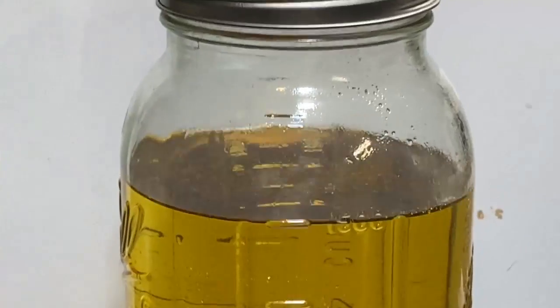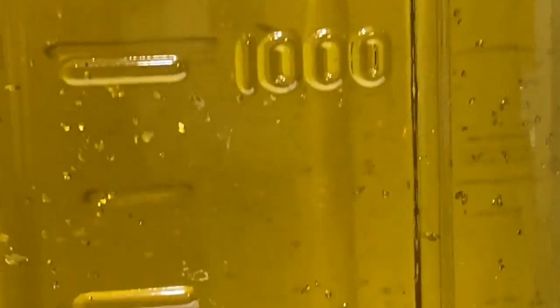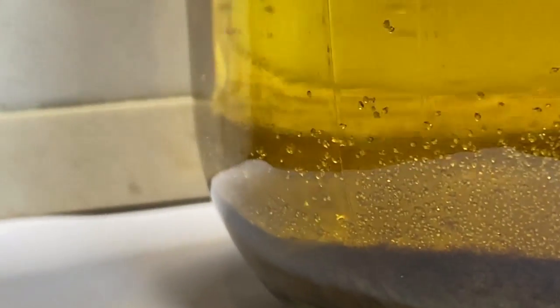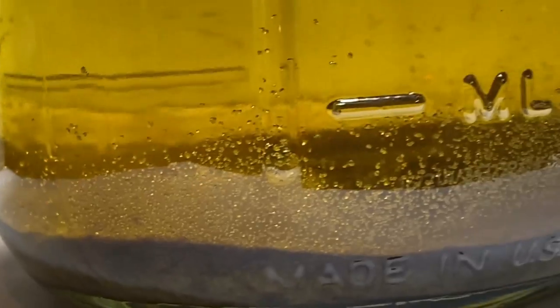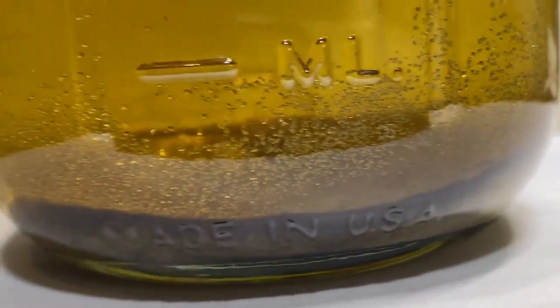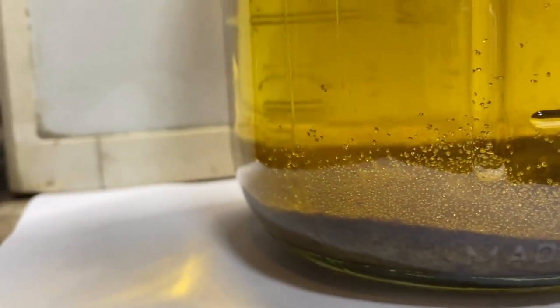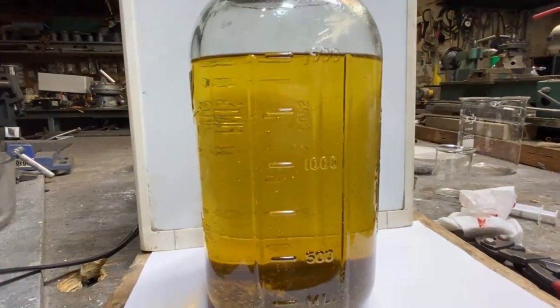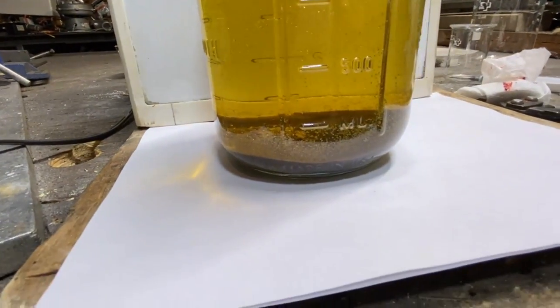Now that yellow color tells us we've still got some sulfur dissolved in solution. You can see all the gunk at the bottom there, so I'll try and decant that. I did several recrystallizations, but I just wanted to show you that those suspended particles do fall out of suspension and end up on the bottom.